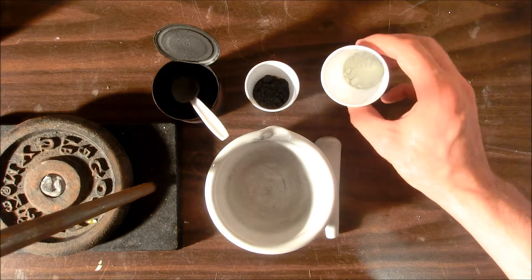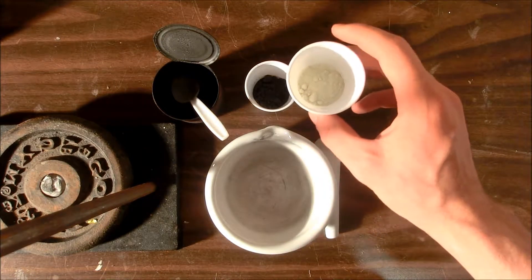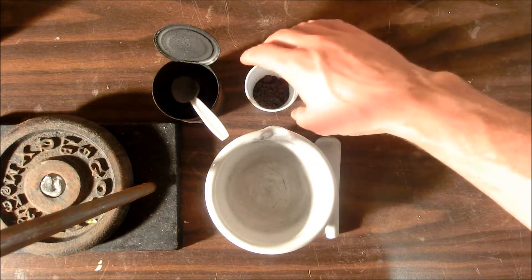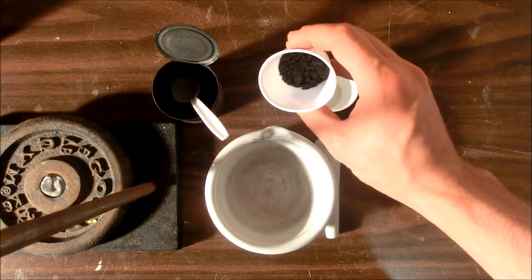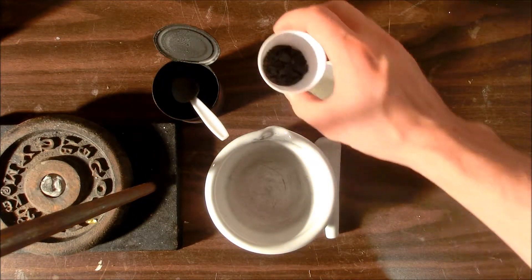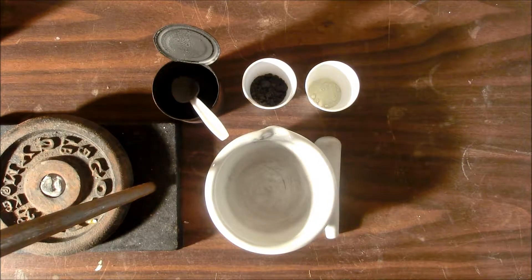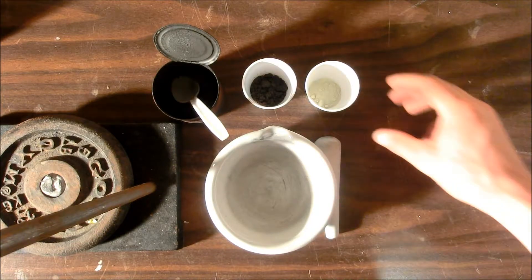So I have four grams of dusting sulfur here that's available from your local home and garden store. And here I have some iron powder that I've had for a while, but you could also use steel wool, also available at your local home improvement spot.